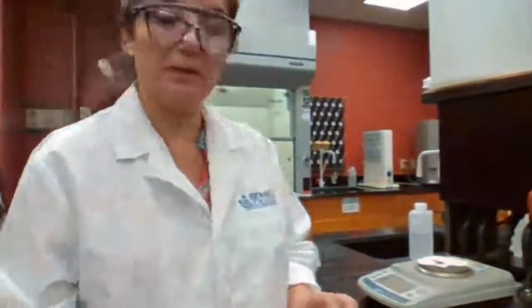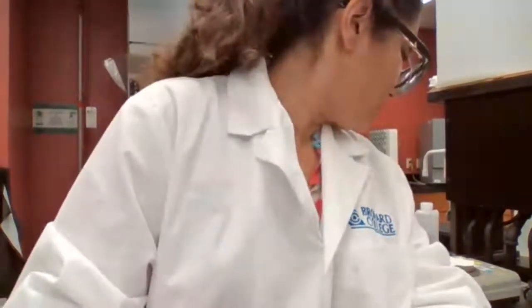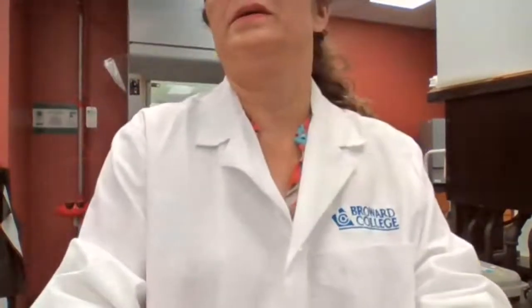The mass is 1.396. 1.396, sorry, 1.396 gram.